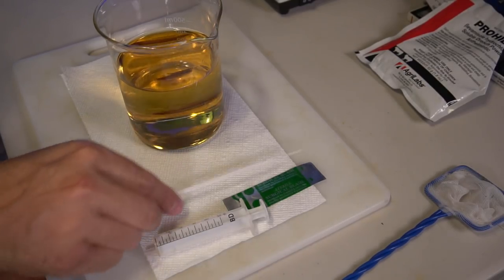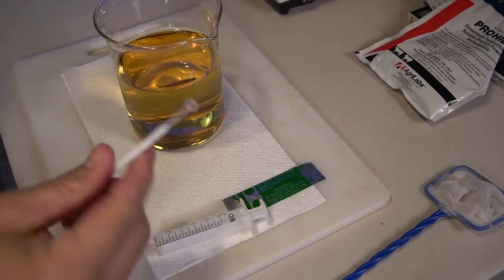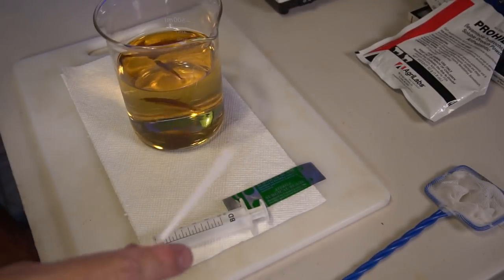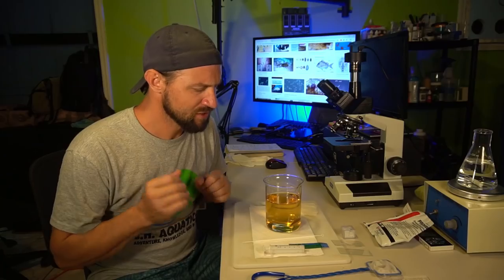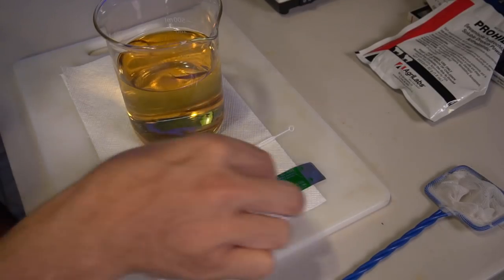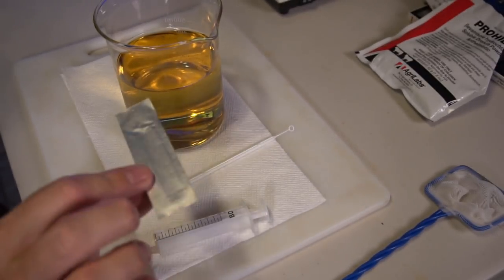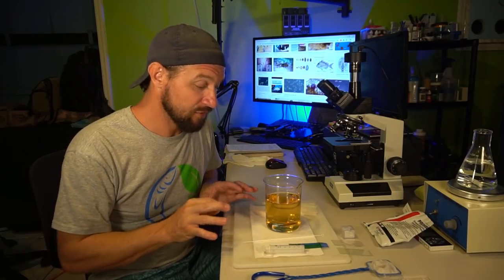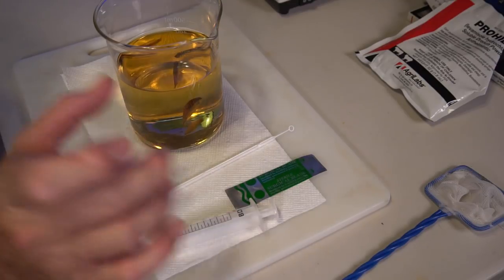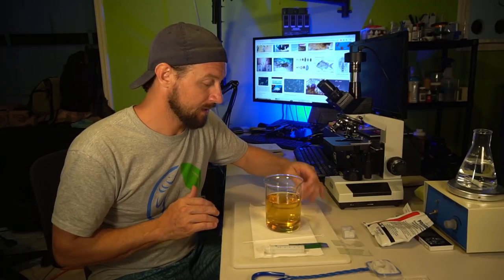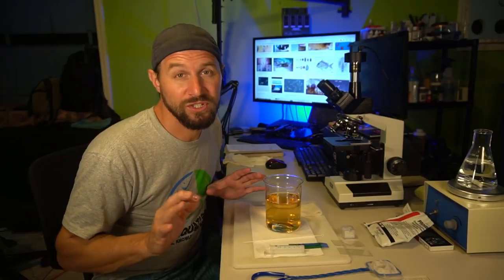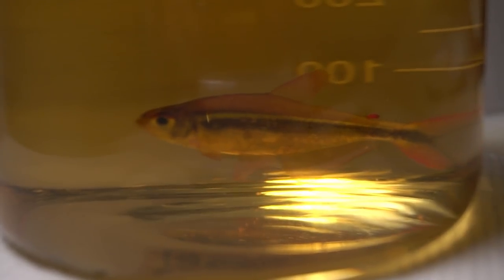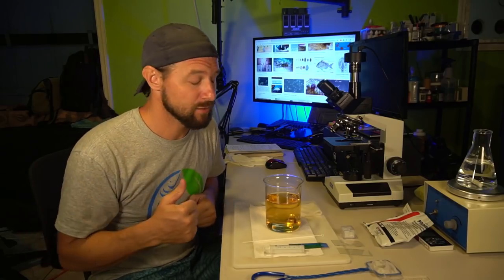Well guys, I am actually really nervous. I've never done anything like this with a fish. I've worked on a swim bladder twice, but I've never actually scraped a specimen of some kind of parasite or fungus or something like that and put it under the microscope. Let me get you guys a little bit closer. I'm going to get this fish out here onto a wet paper towel and then cover him up with another wet paper towel. I'm going to get this culture sample as quickly as possible, get it onto a microscope slide, get this fish back into the water and back into a tank.